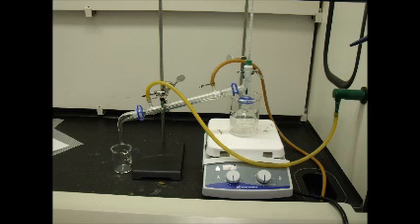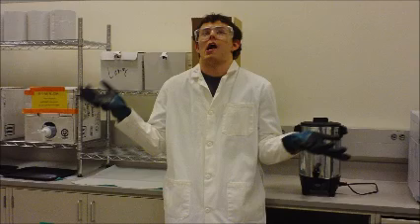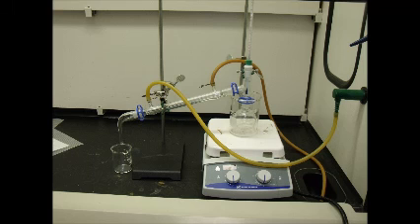It is very important to make sure that the rubber tubing is not touching the hot plate or it will melt and the glassware may overheat and explode. Now your distillation apparatus is ready to be put to use in whichever way you see fit to use it.